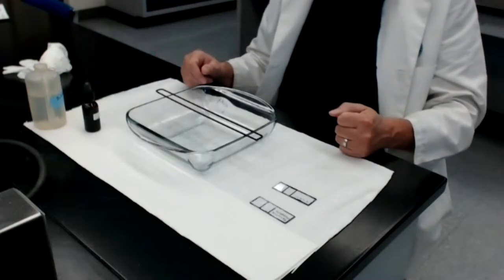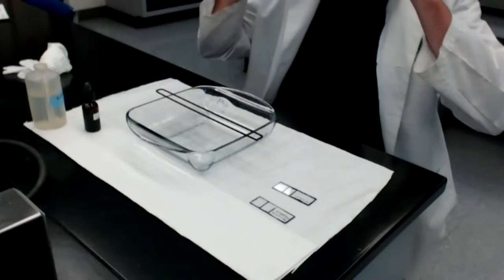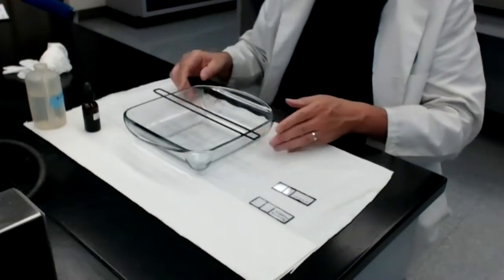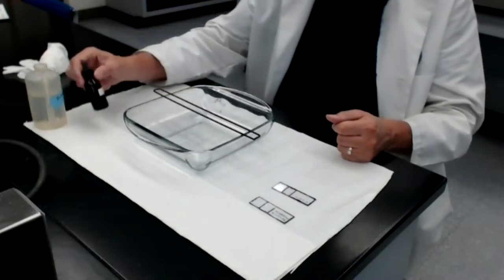But let's move into the material covered by Lab Module 5. Lab Module 5 instructs us in how to do a simple stain. By definition, a simple stain is a stain that uses only one dye. We're going to be using methylene blue staining solution.